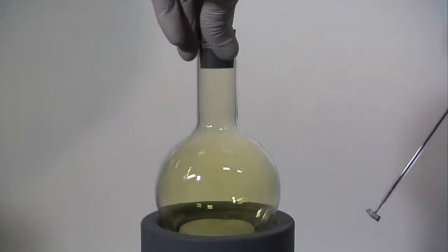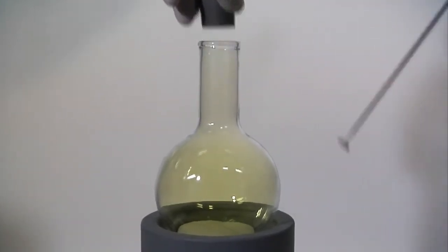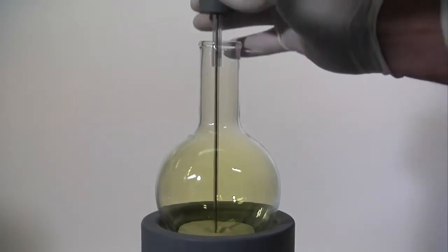A long syringe needle has been used to pick up a small piece of sodium, and using the glass tube, it is dropped into the sand.